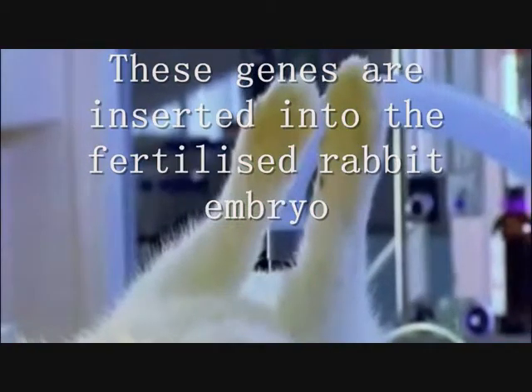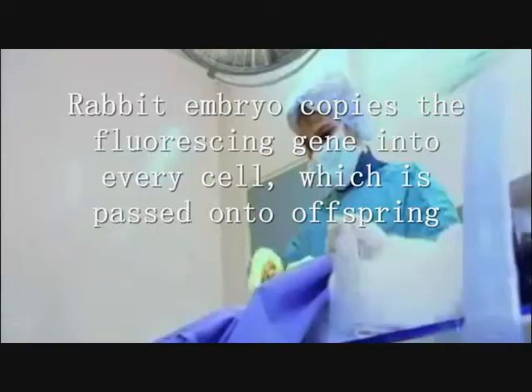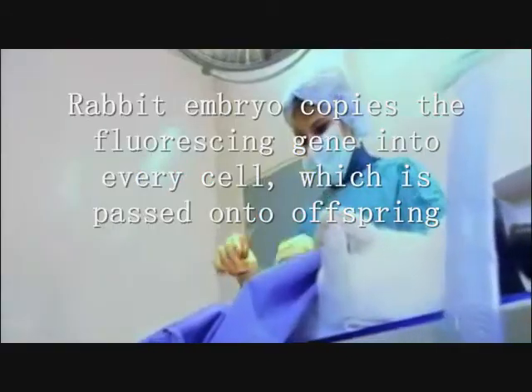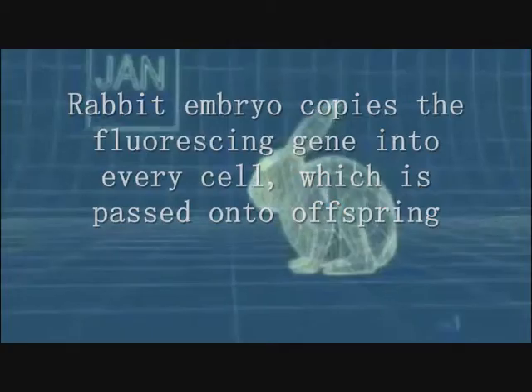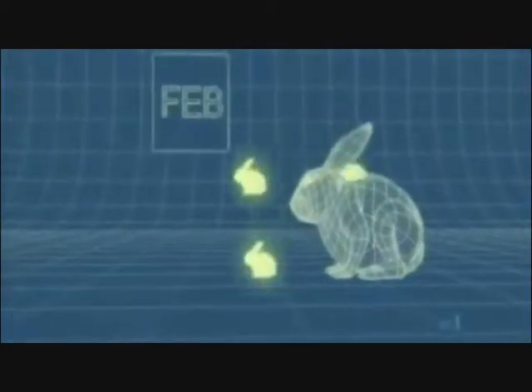This egg is then placed into the mother. As the egg grows to form, the rabbit embryo copies the fluorescing gene into every cell. 31 days later, you've got fluorescent bunnies.